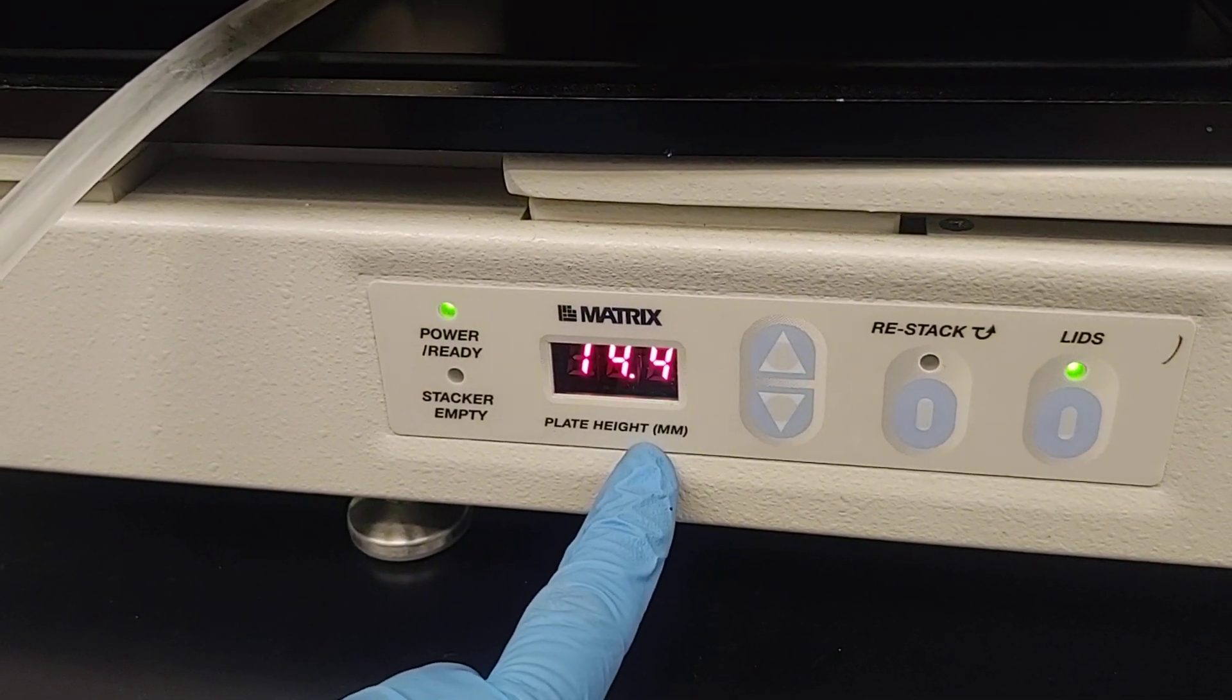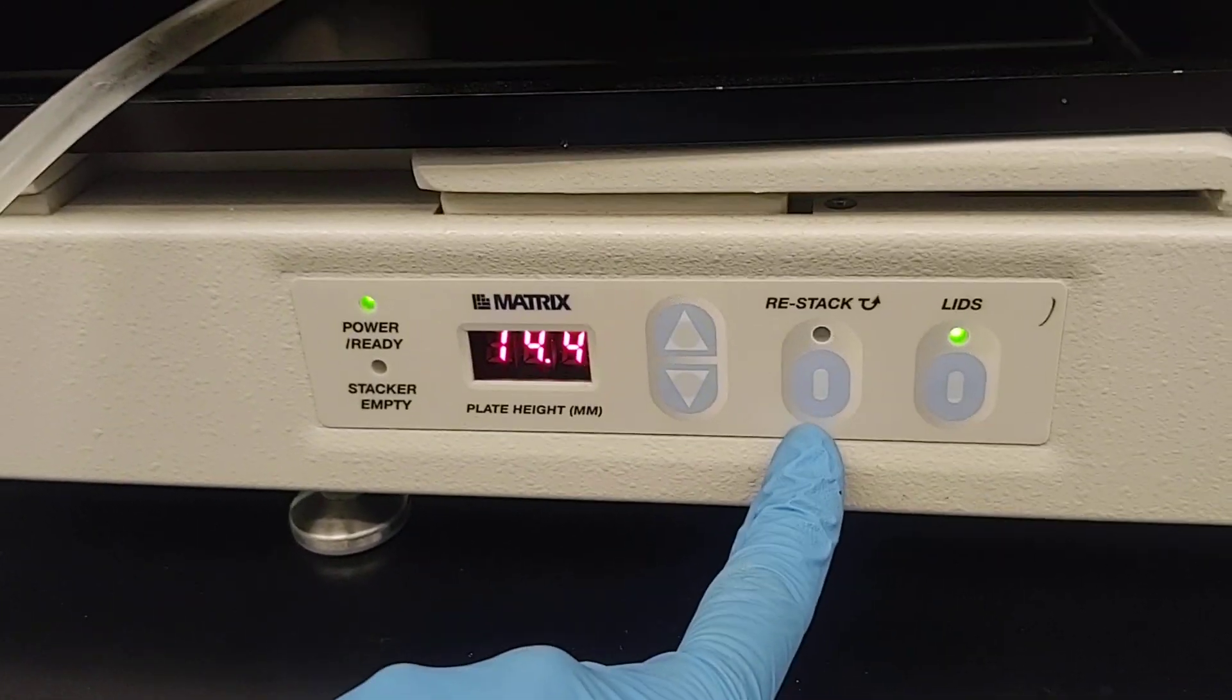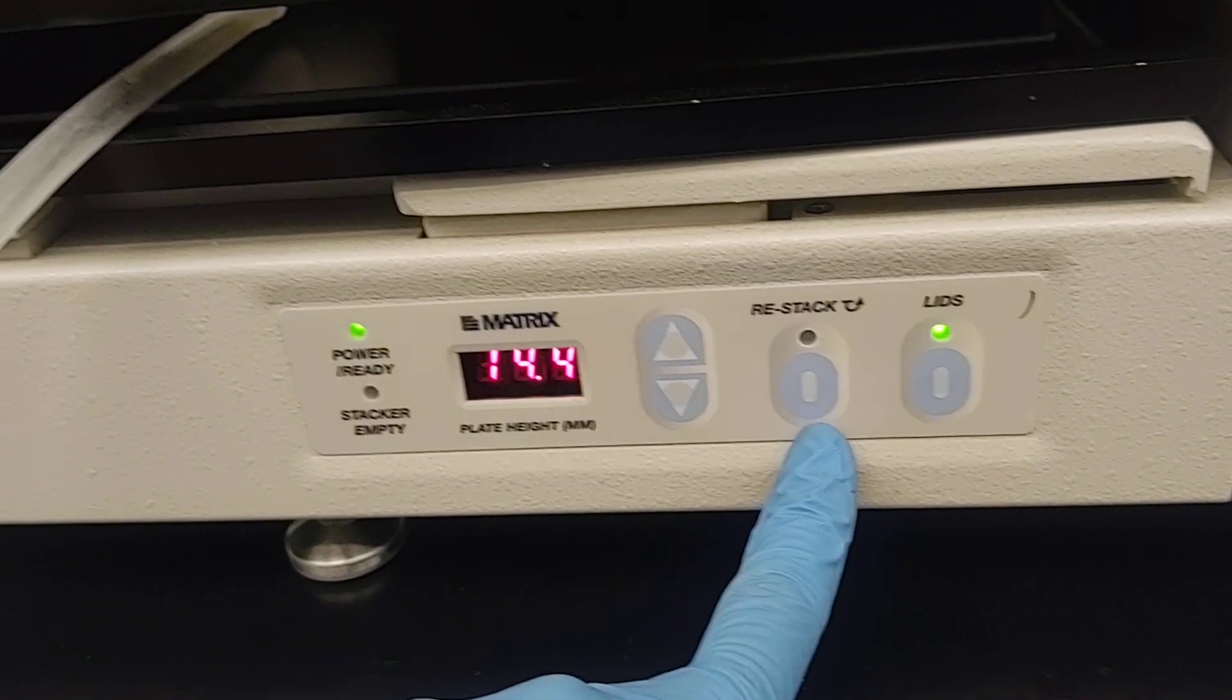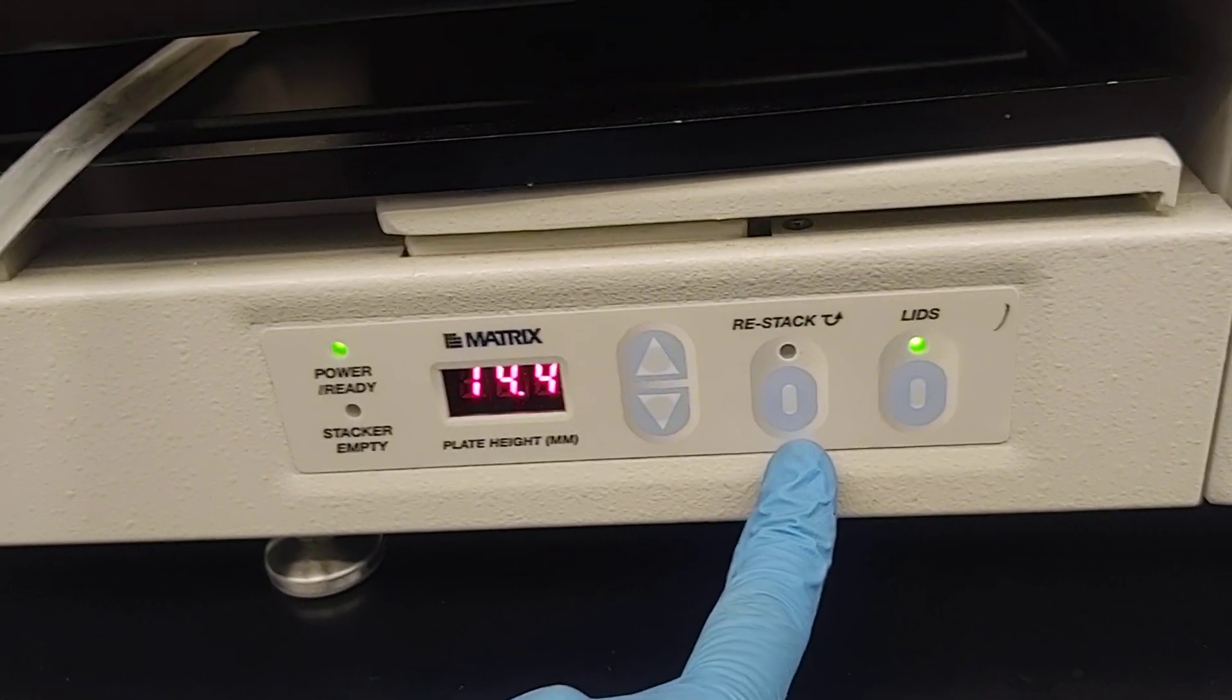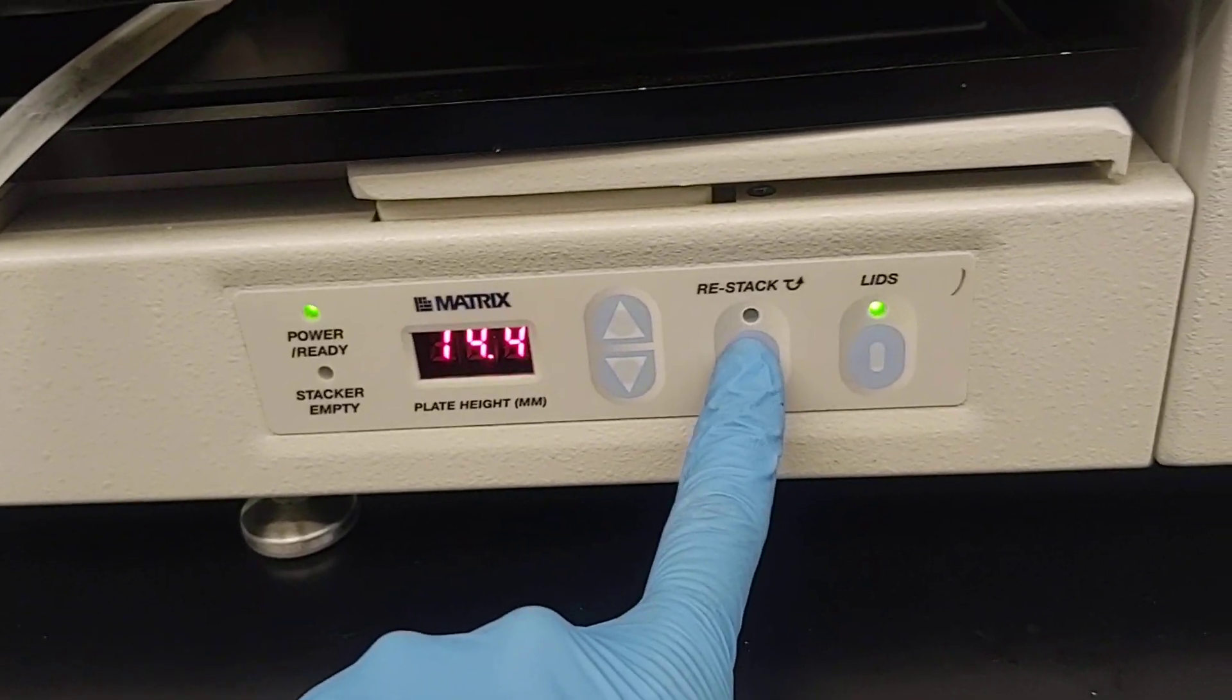Adjust for the plate height if needed. This works for most of our plates. If you want it to restack your sequence of plates into the original sequence at the end of the dispensing of a stack of plates, then you would toggle this on.